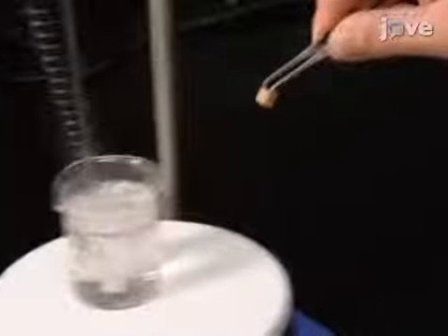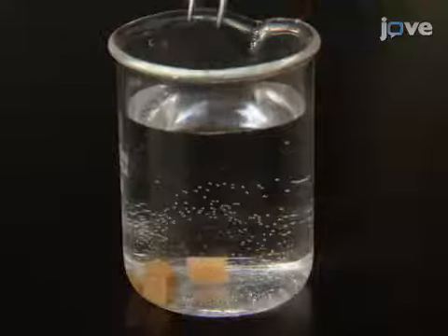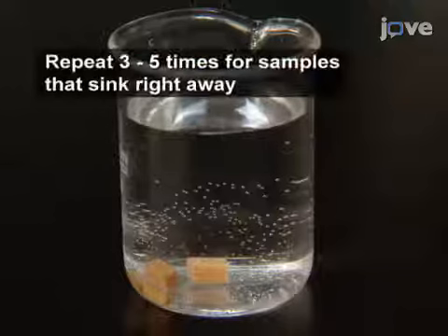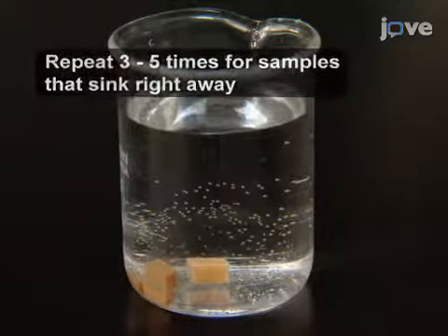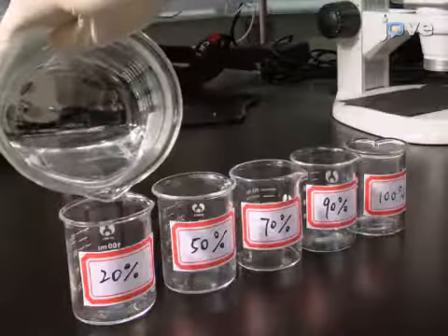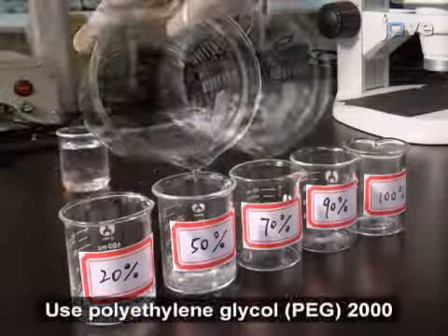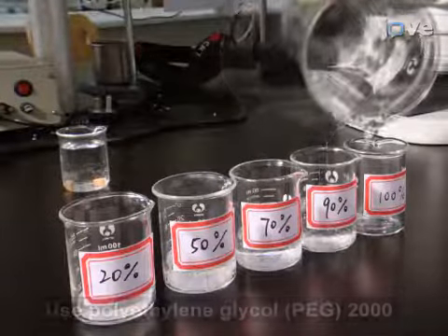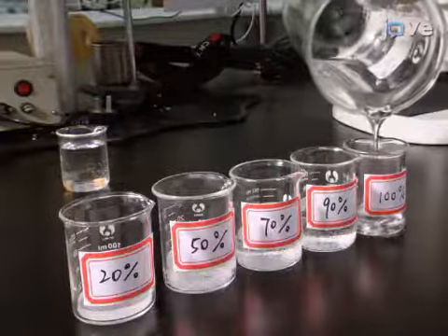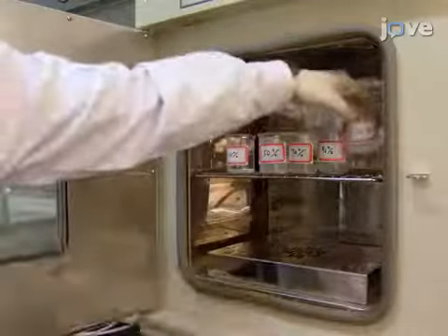Repeat this step until the tissue sinks to the bottom of the container, indicating that the air in the tissue has been removed and that the tissue has softened. Prepare 20%, 50%, 70%, and 90% aliquots of PEG in deionized water, as well as pure PEG, and keep the solutions at 65 degrees Celsius.